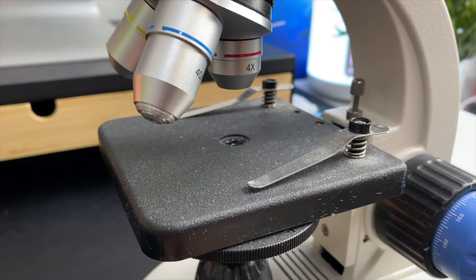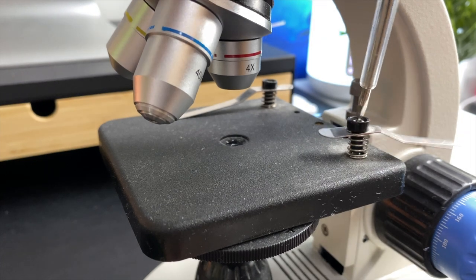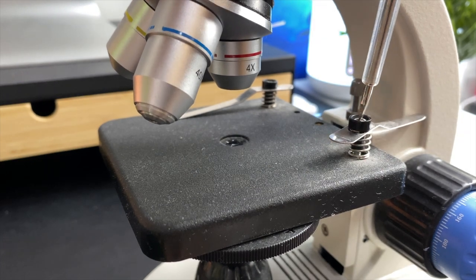Alright, so let's start to disassemble the clips with a screwdriver. I'm going to speed it up now.